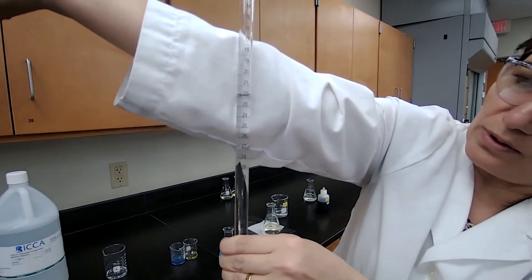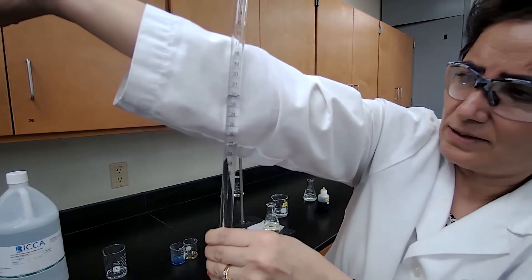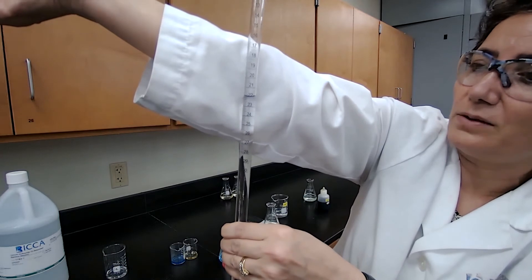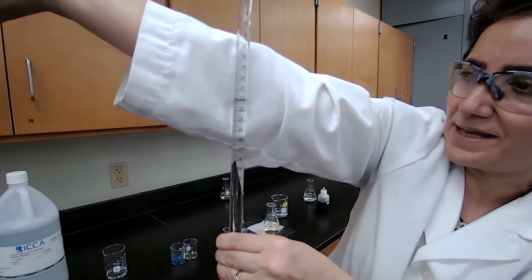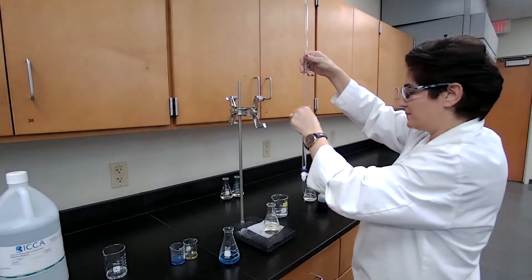And you can record this as the end point or the final volume or final burette reading for trial one of part B.